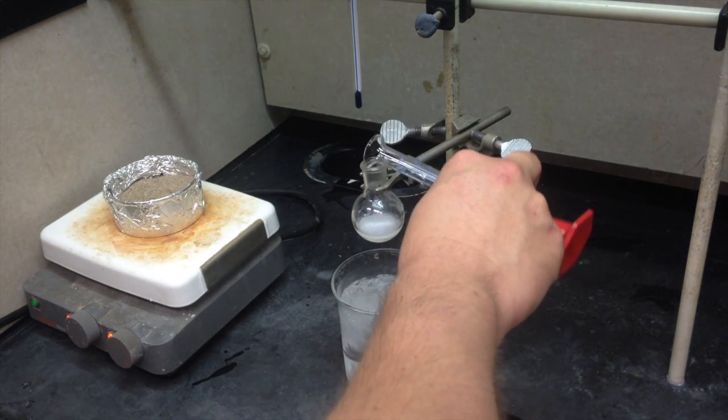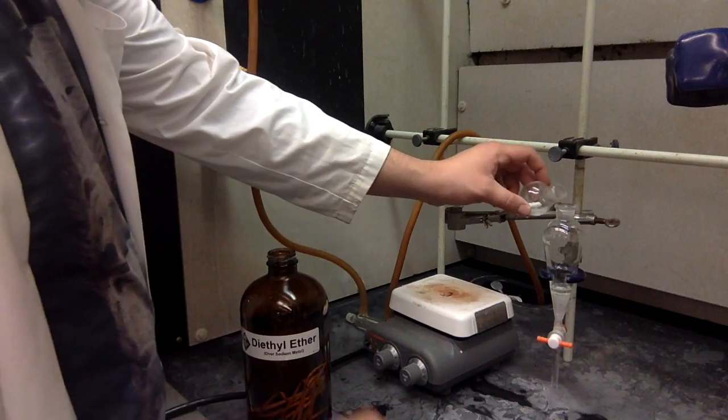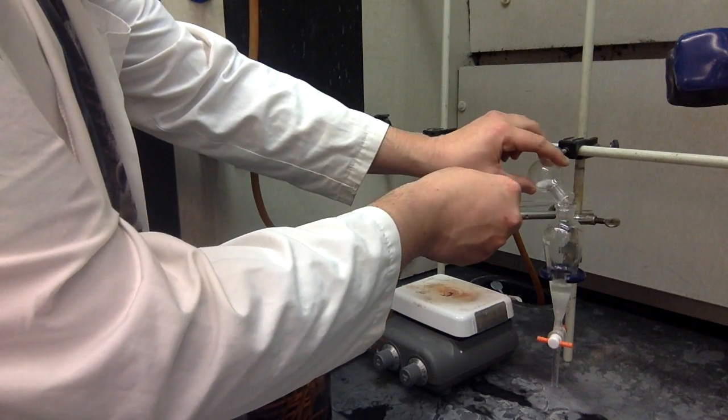Add in the ether, stir to combine, add this to the separatory funnel, rinse out the round bottom with a little bit more water, add that to the separatory funnel.